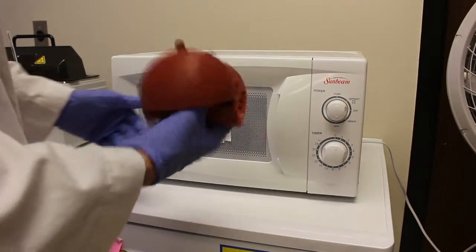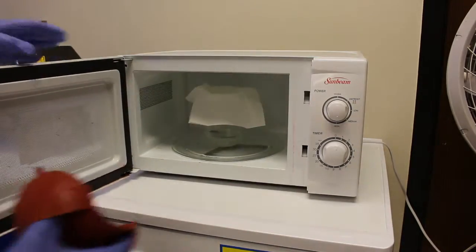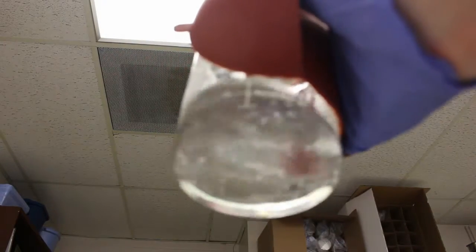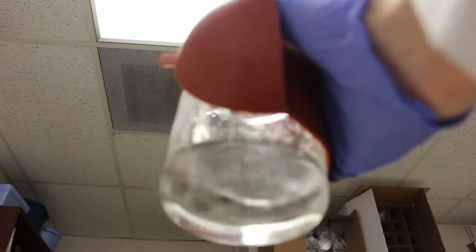Ensure that all the agarose has dissolved into the TAE buffer before continuing. You can hold the beaker up to the light and swirl the solution to ensure that all the agarose has dissolved. If any flakes or particles of agarose remain, reheat the solution.